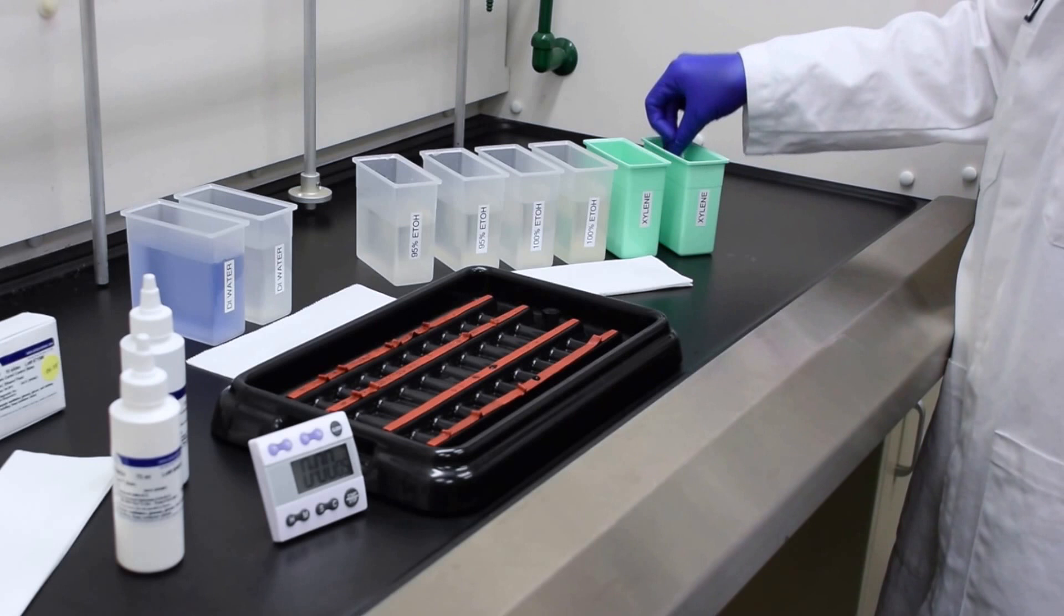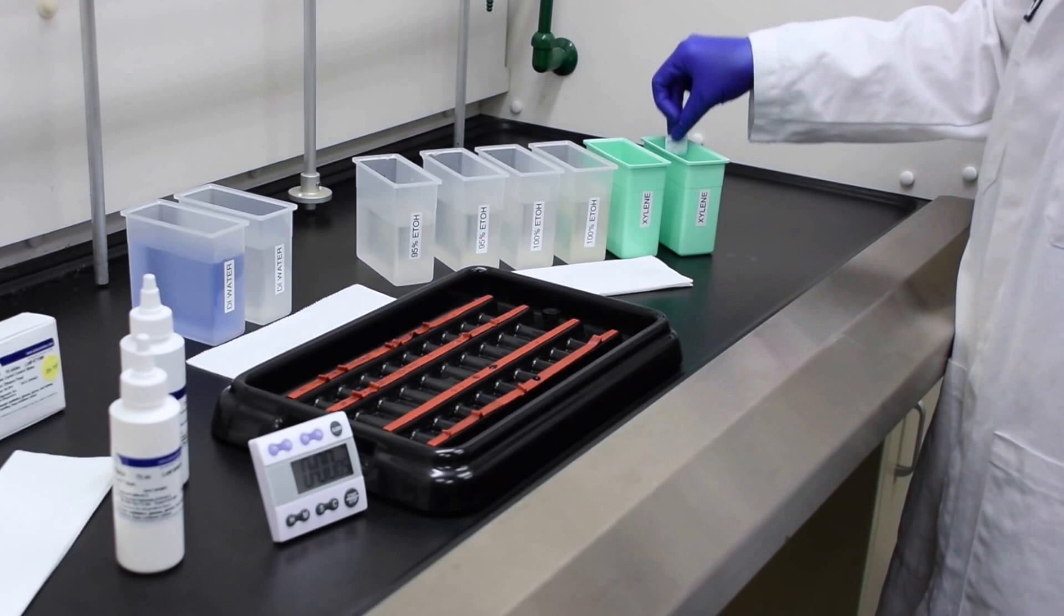The slide is now ready to be coverslipped. Now we're ready to begin coverslipping.